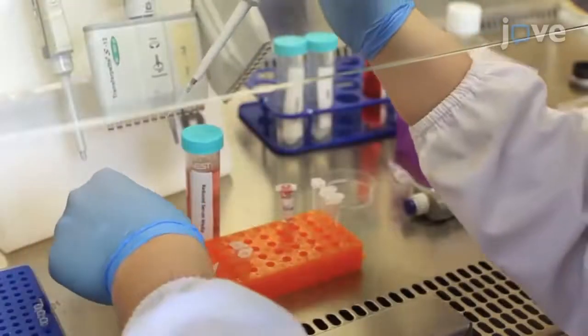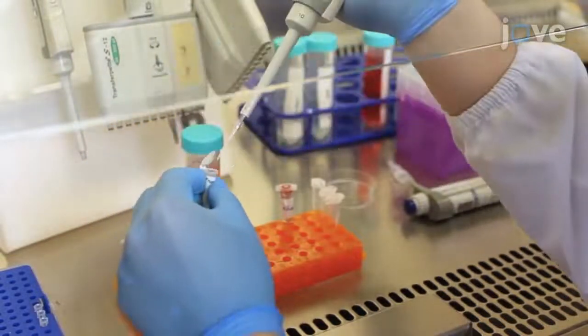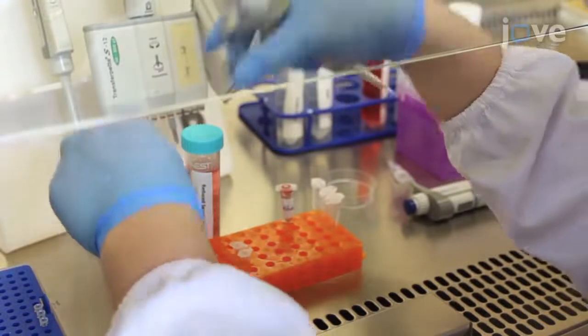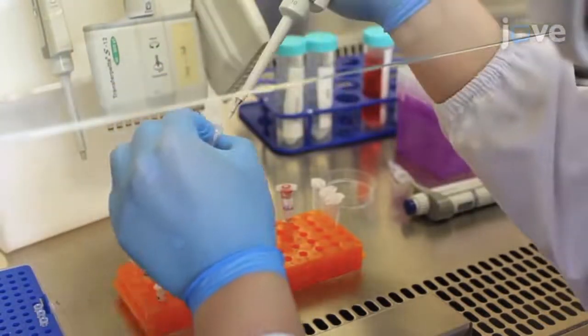Gently dilute 100 picomoles of CLIC4 small interfering RNA or scrambled small interfering RNA in 250 microliters of reduced serum media.